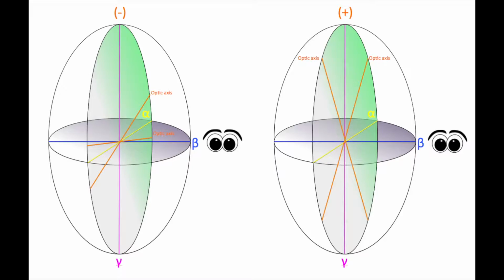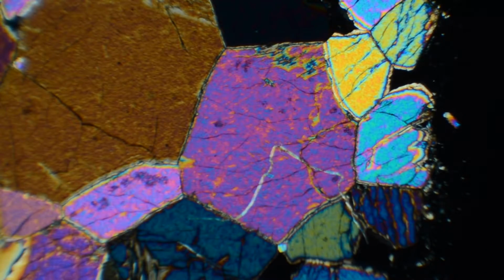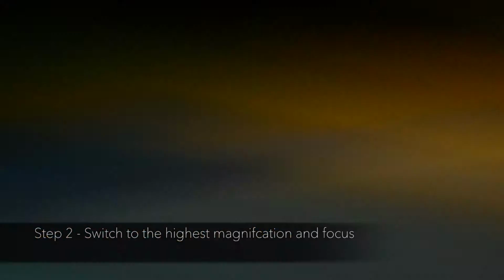Now, let's go through the steps to acquire a flash figure. Step 1. With the cross-polarized lens in place, find a grain of a chosen mineral that exhibits particularly high retardation and interference colors. Step 2. Switch to the highest magnification and focus.